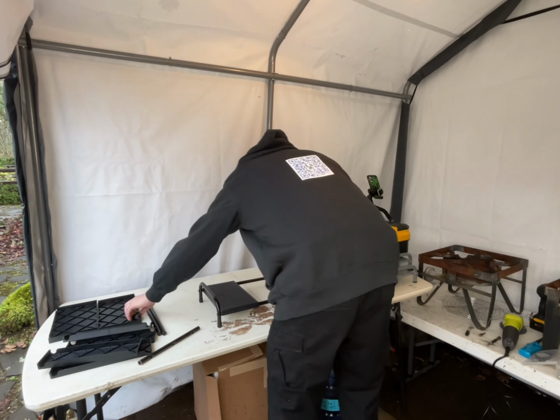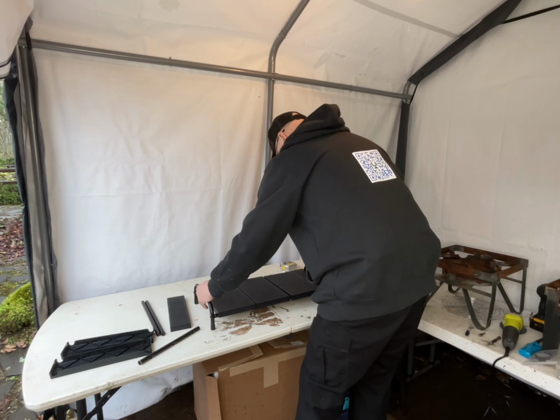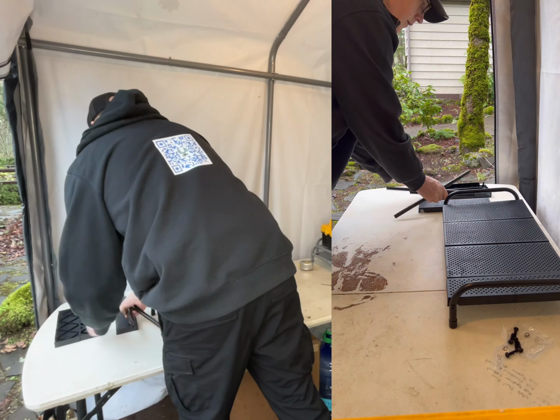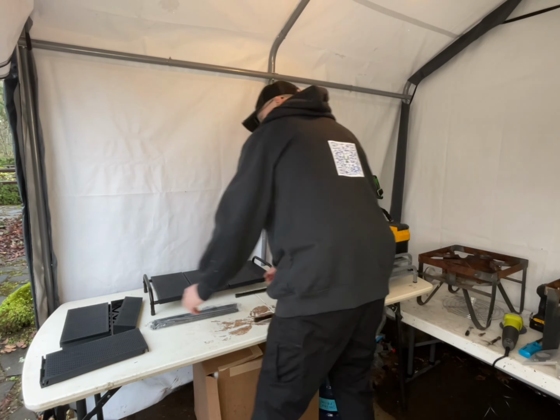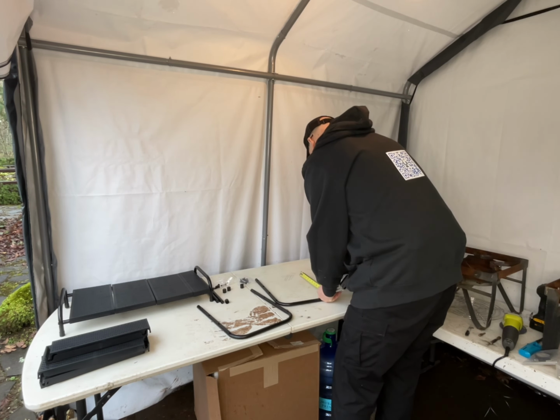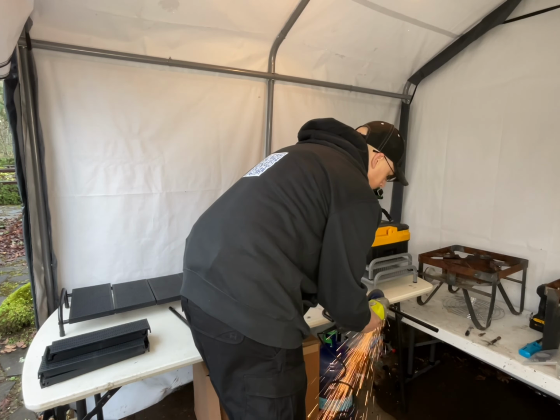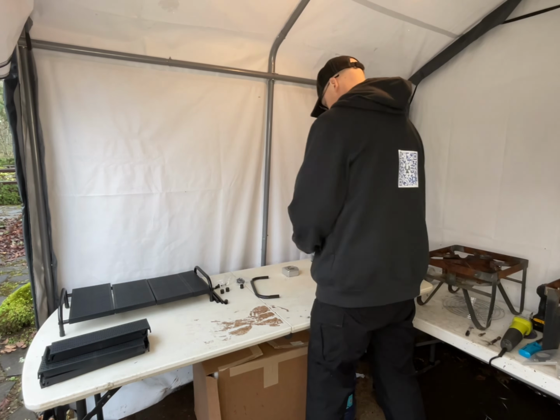And then I'm just using their little telescopic poles that come with it and extending them between the two U-shaped supports and putting the screws in there. And then just set the surface panels on there and it makes it pretty decent. One thing you want to do, like I did there, is put the panels on so that they sit level. The little telescopic poles, one is skinnier than the other, so you will want to set several of them on the skinnier one and several on the taller one so that each of those sit level if you're pouring agar. If you don't care about it, just throw them together how you like.